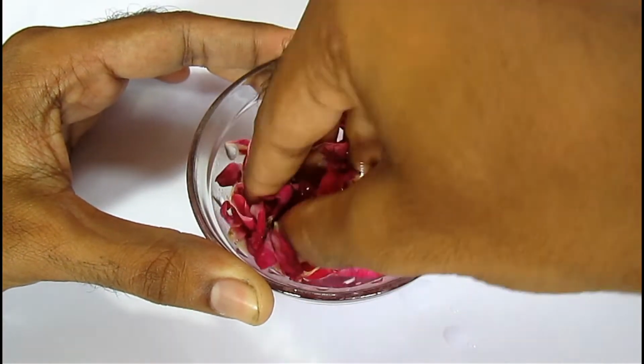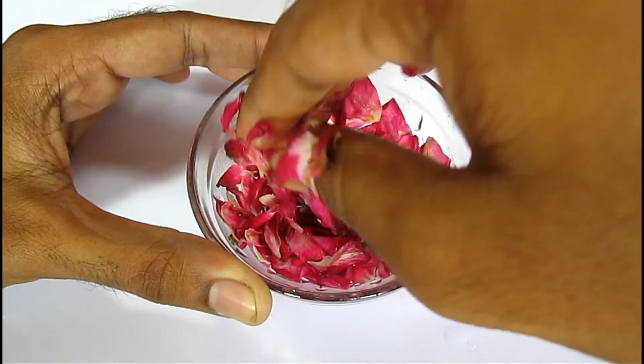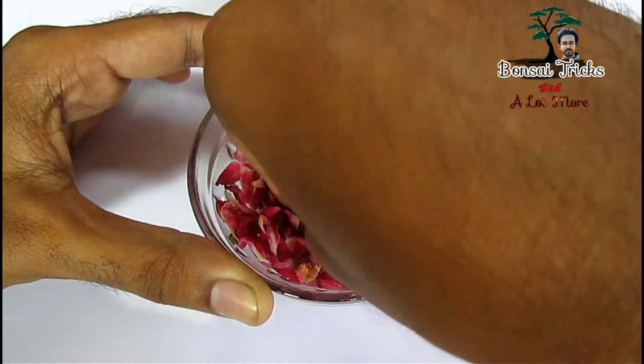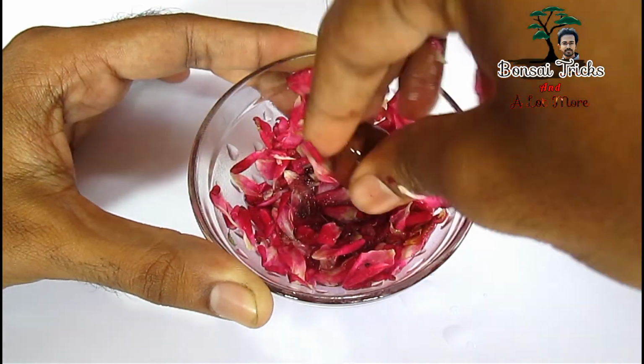First of all, make a thick paste of your rose petal with your finger. Do not use mixer or grinder, it will heat up the solution and it will damage its chemical property. You can use small gravel to grind the petals.